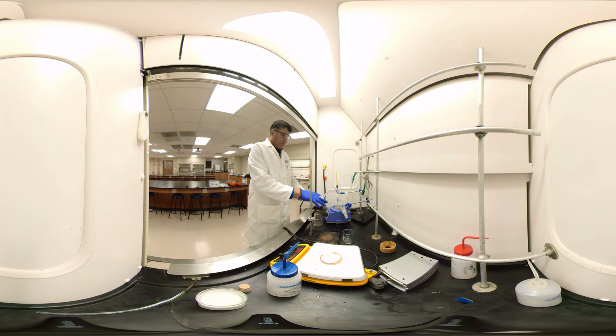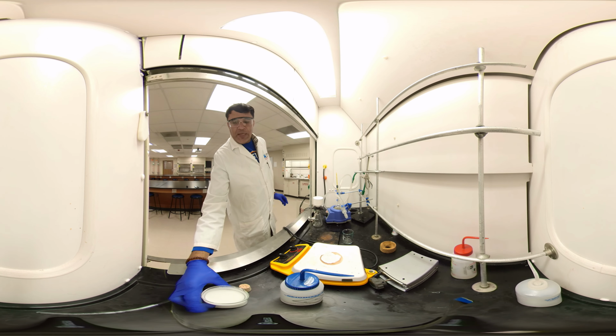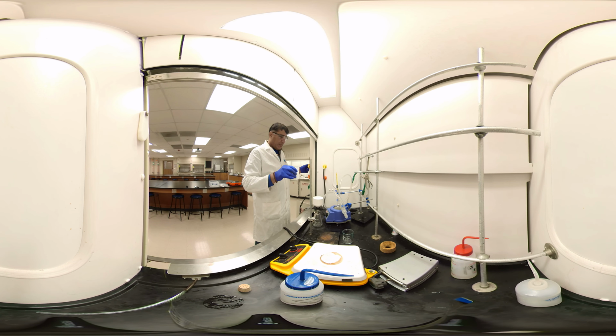So I set up my filter flask. I'll make the filter wet. So I'm working parallelly here. I hope you can see it. Like down the filter paper there. And this is benzoic acid. After filtering it with the vacuum filtration I set up. I know you know how to do filter paper or the filtration, the vacuum filtration. So just put it there.